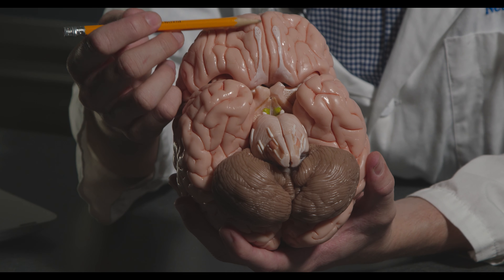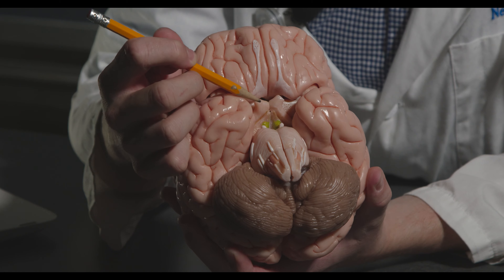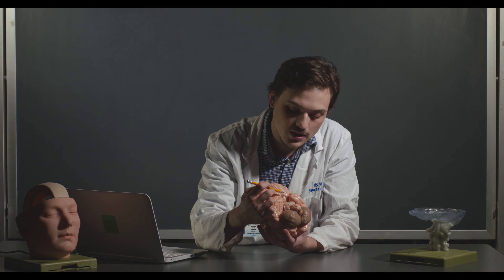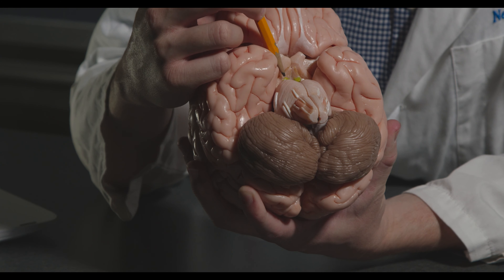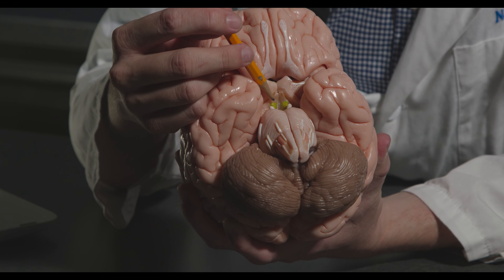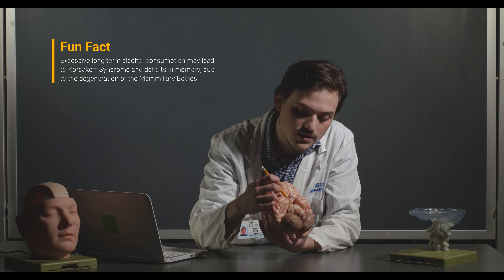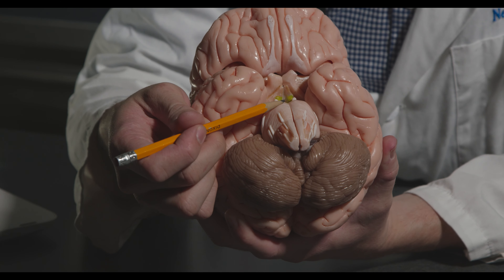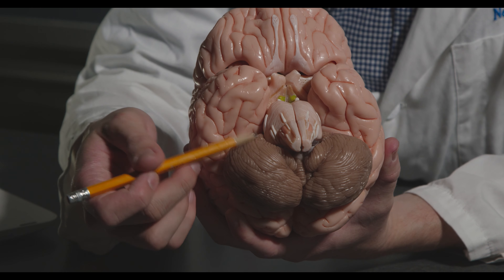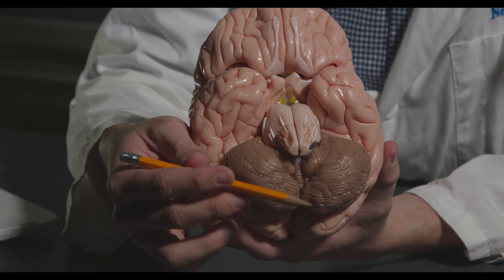Here you can see the longitudinal fissure — the giant groove separating the brain into two hemispheres. Then we have the optic chiasm. The word chiasm comes from chi, the Greek letter that looks like an X, because this is where optic fibers cross over to the other hemisphere. Just posterior to that are the mammillary bodies, which are really important for learning and memory. Fibers from the fornix come down to the mammillary bodies and then go up to the anterior nucleus of the thalamus. Here we have the pons, relaying information through the middle cerebellar peduncle to the cerebellum, and then the medulla, which transitions into the spinal cord.